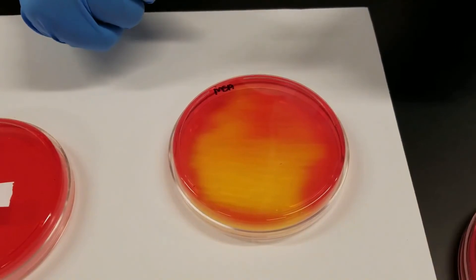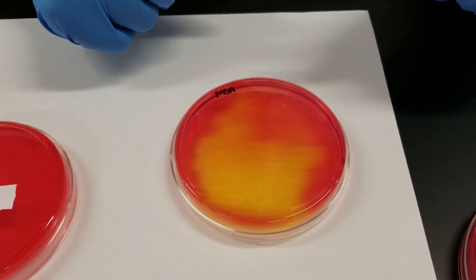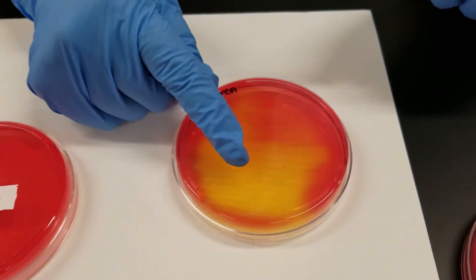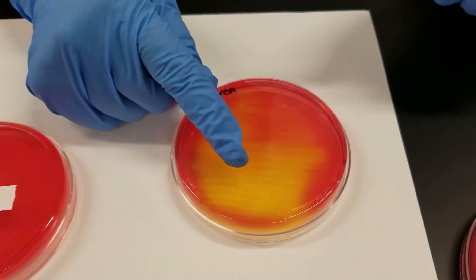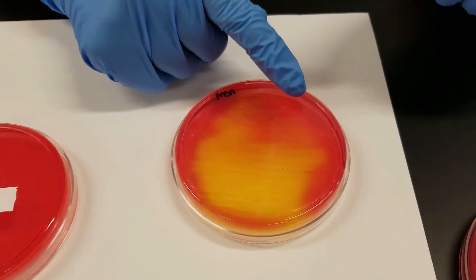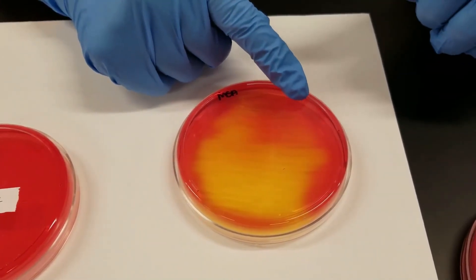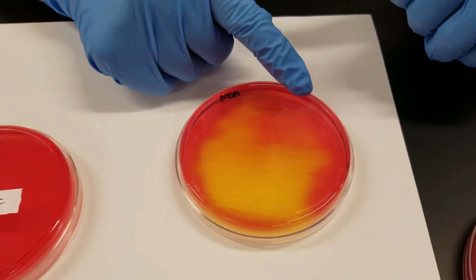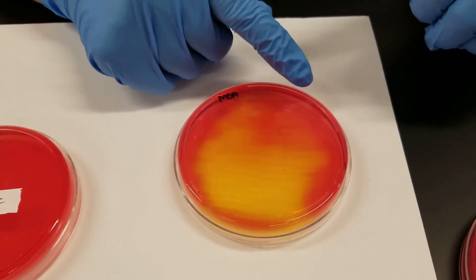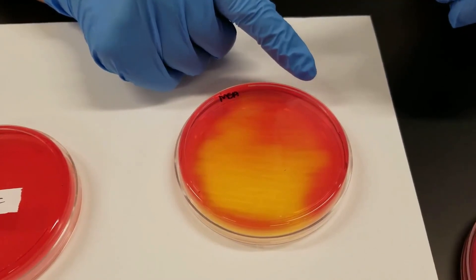You look to see: A, if there is growth, it has to be a staphylococcus species. And then if it turns yellow, it has to be staphylococcus aureus. If it remains the pinkish, normal beige color and does not turn the media yellow, then it would be one of your other staphylococcus species such as epidermidis that we work with in the lab.